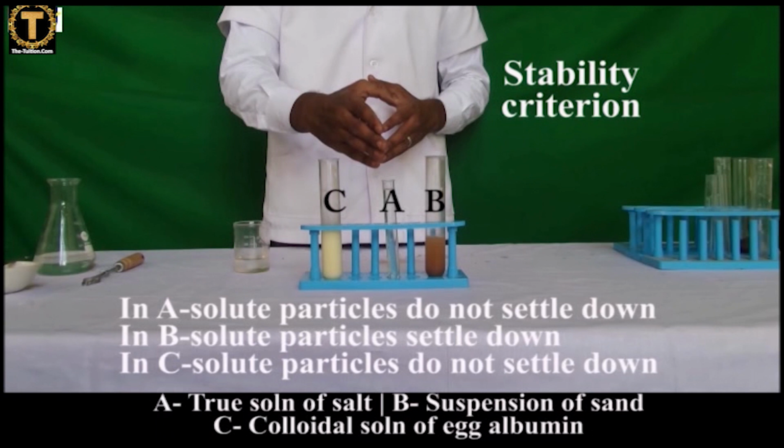To check stability criterion, take 3 test tubes with a colloid, suspension and true solution in each respectively. Shake all the test tubes and keep them in the test tube stand. Allow it to stand for 5 minutes. Record your observations.